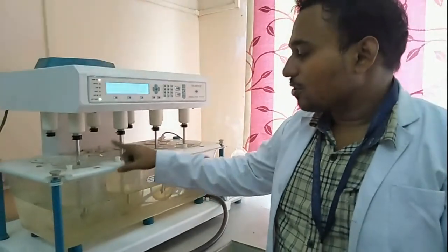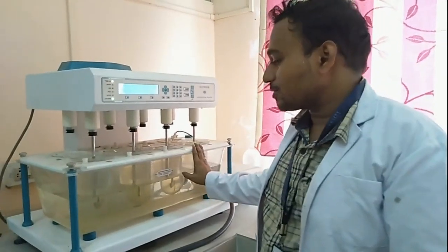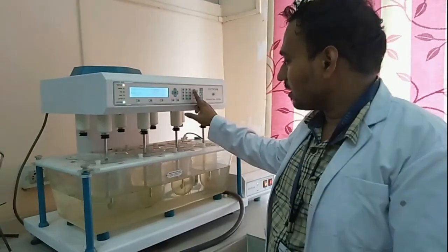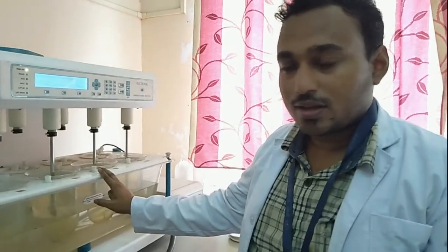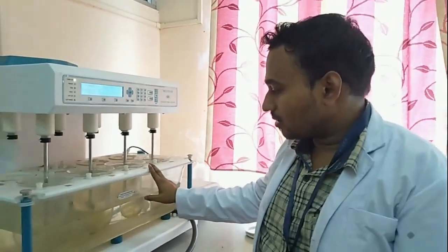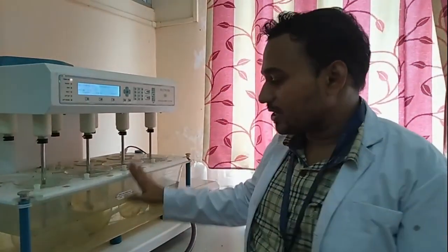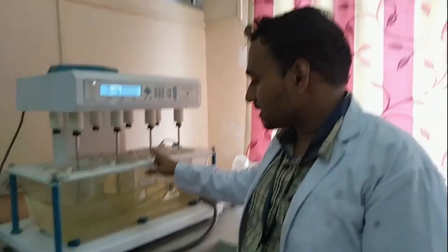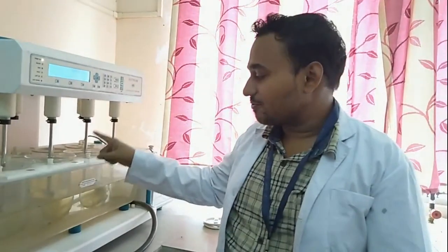After collecting the samples, they are taken for UV analysis and absorbance is recorded. The temperature of the dissolution medium must be maintained at 37 degrees Celsius throughout the 6-hour dissolution. Every half-hour interval, a sample is collected for UV analysis.